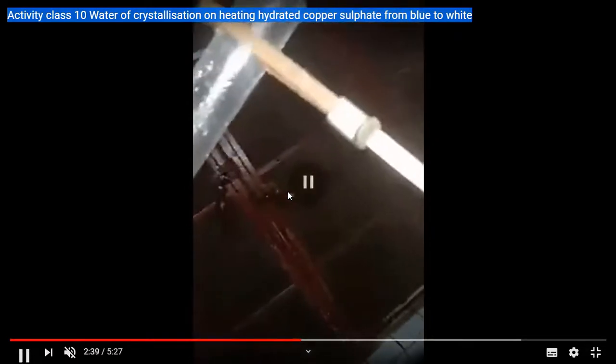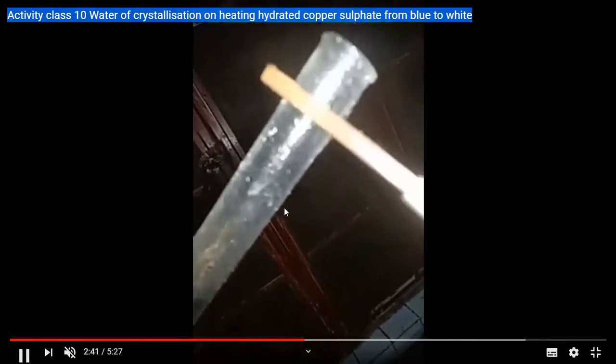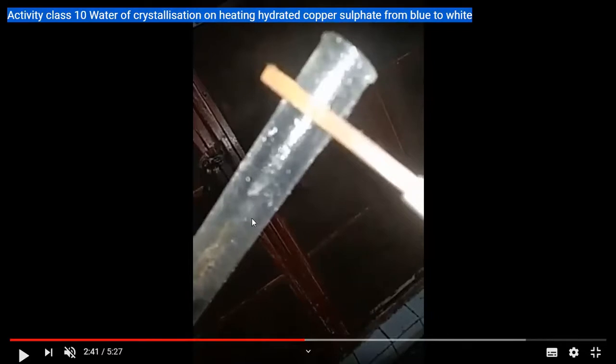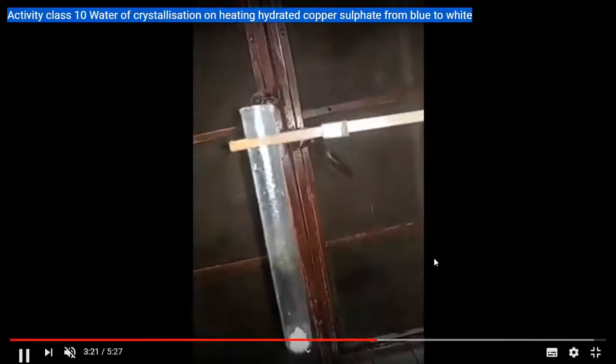Let us observe the mouth of the test tube and see what you can find there. You can see there are lots of water droplets collected at the mouth of the test tube. When we had taken the test tube there were no water droplets available. But now you can see the water droplets collected at the mouth of the test tube.